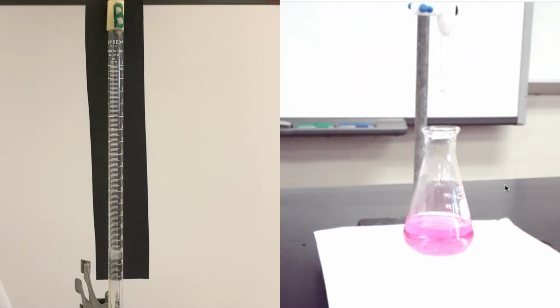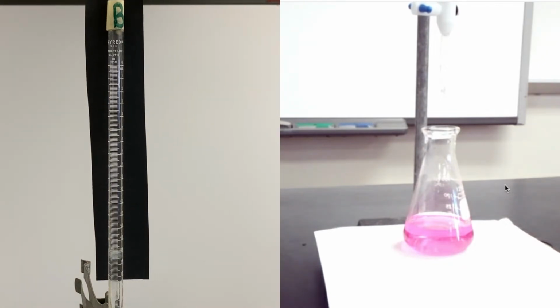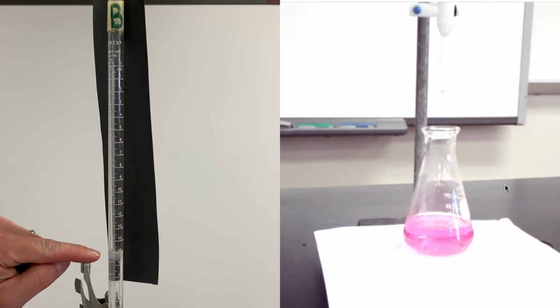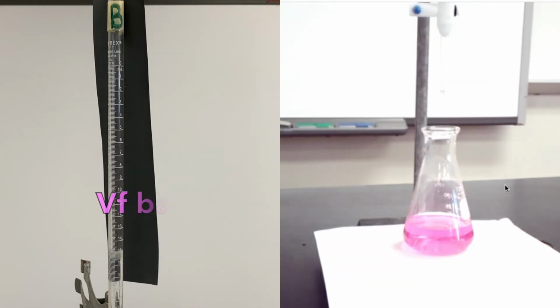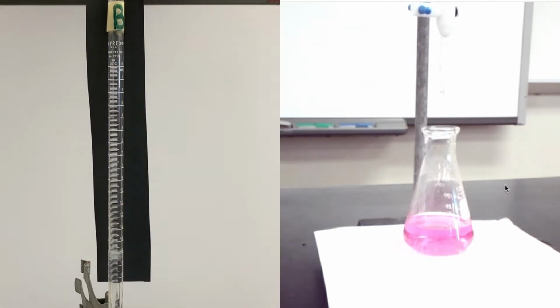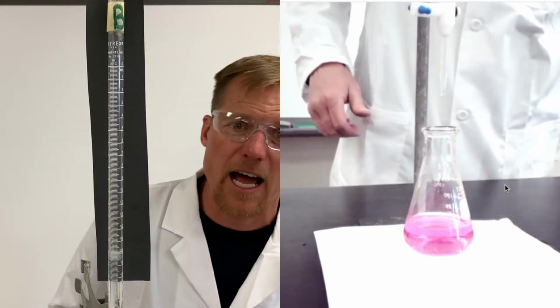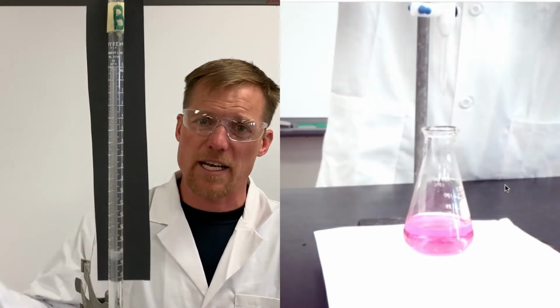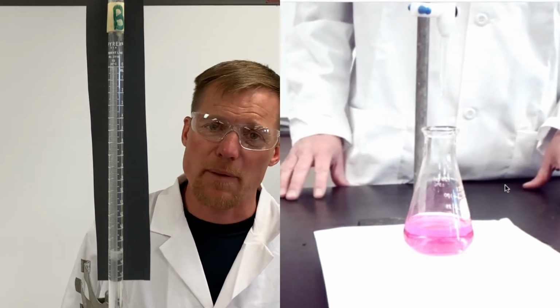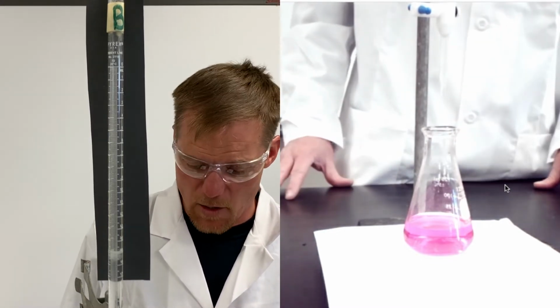If we look at our burette, we'll see that we got down to right around, wow, we went from 0 right to 15. We are right on the money there at 15.0, okay? So that gives us an idea of the concentration of our acid and how much acid and base we're gonna need to use in conjunction with one another. So now we have a good basis to run our next 3 trials, okay?